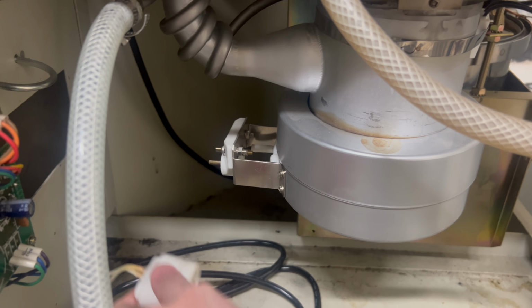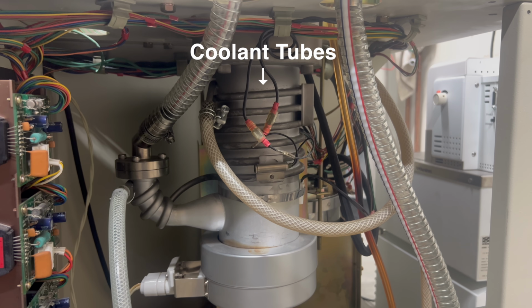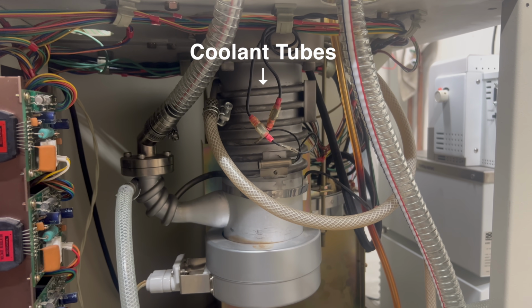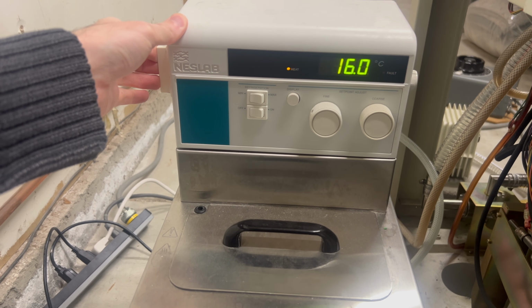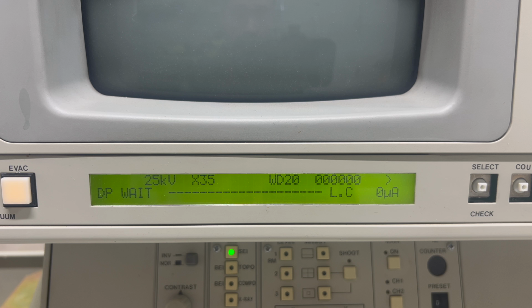Now that we know the system is not leaking, it's finally safe to run the diffusion pump. This pump needs cooling water to circulate through these tubes, or else it will overheat. Fortunately, I was able to scrounge up a small chiller unit that should be just enough to keep this thing cool. I hooked up the tubing and verified that nothing was leaking. After about 20 minutes, the pump was hot and the machine automatically switched modes from DP wait to pre-evac.